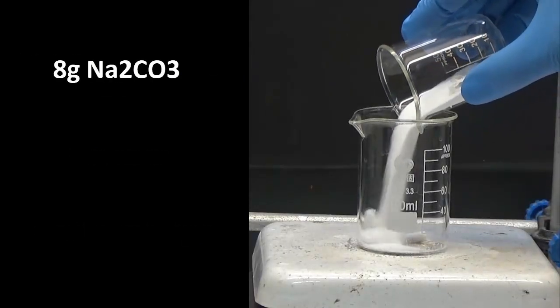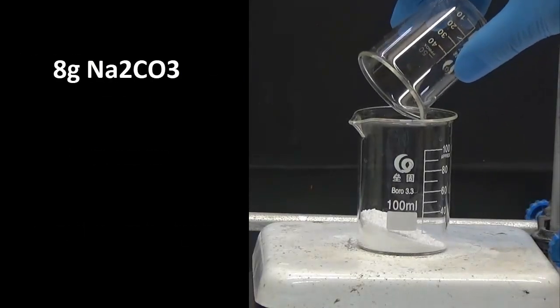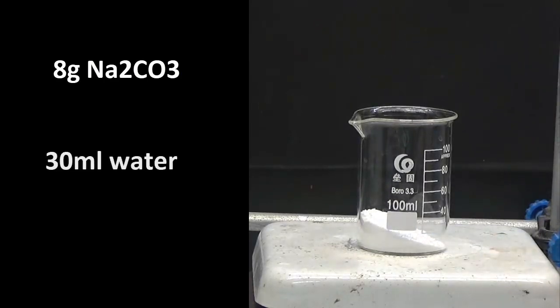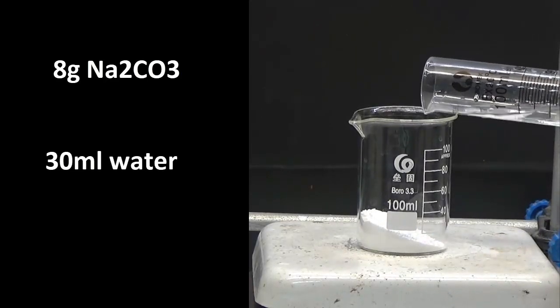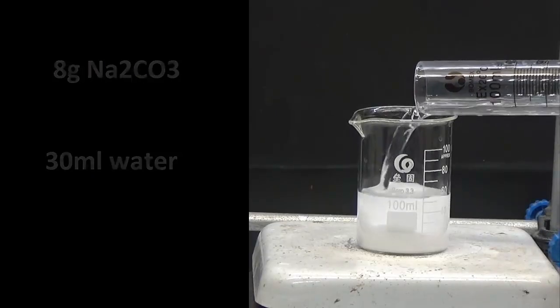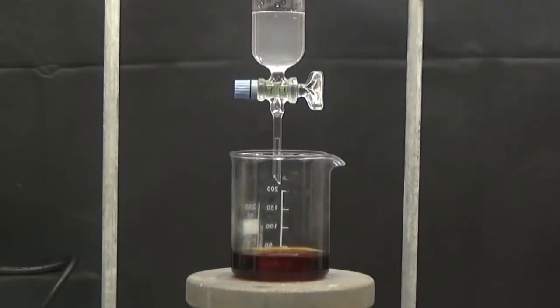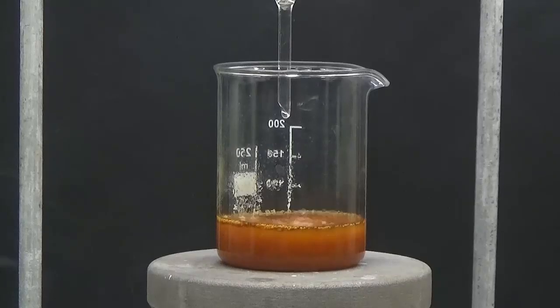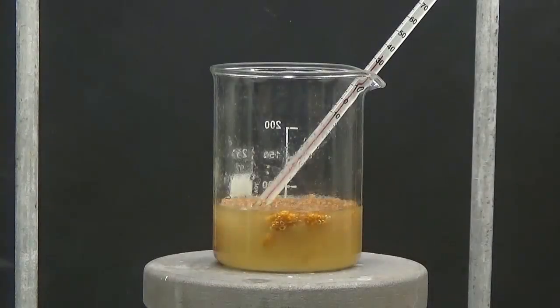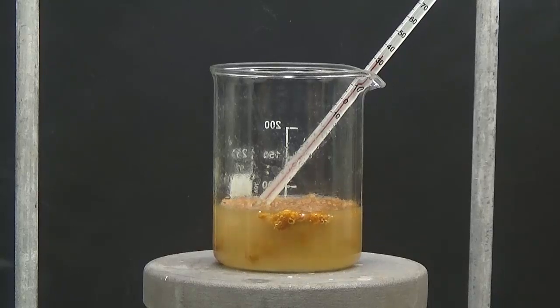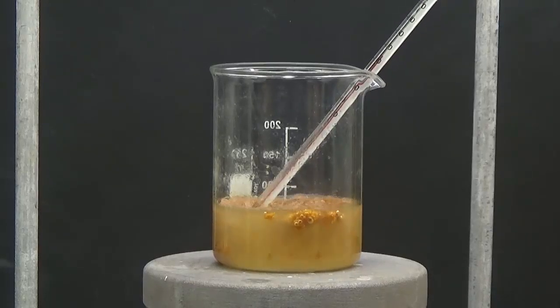Prepare a solution of 8 grams of sodium carbonate in 30 milliliters of water. Drip add the sodium carbonate solution into the furfural solution with hydroxylammonium. Water-insoluble furfuraloxime is now formed.